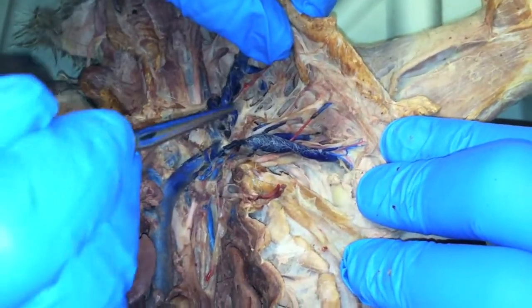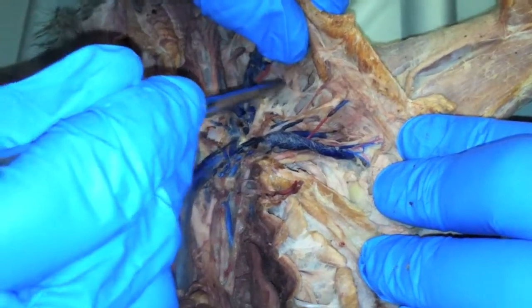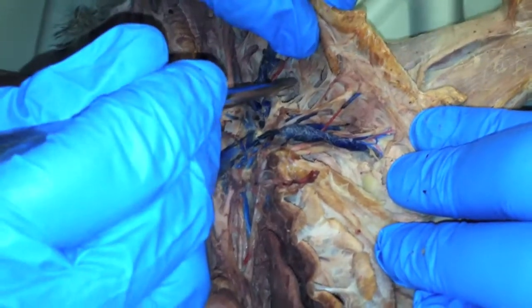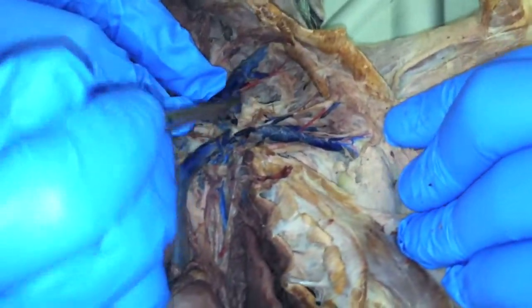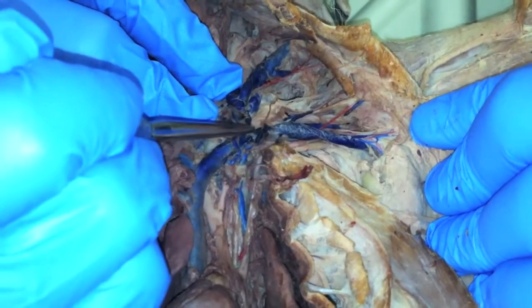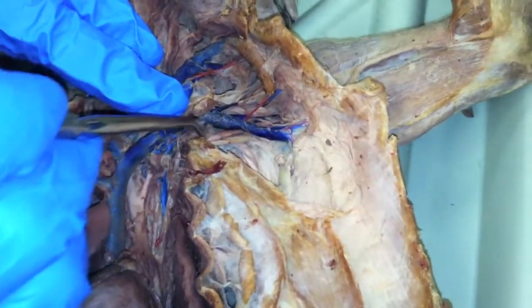Coming up this way. So there it is coming up right there. And then there's your transverse going back that way. See it right there? And that's running with the vein by the same name. So this is your thyrocervical coming up right there, from there. It's behind here and then heads up right there. Once you get past that point, now the main one is called the axillary.